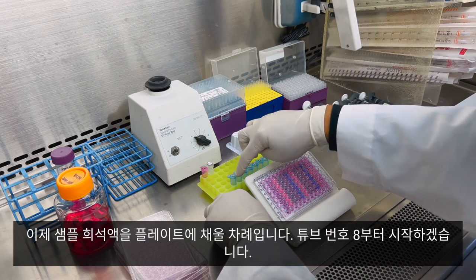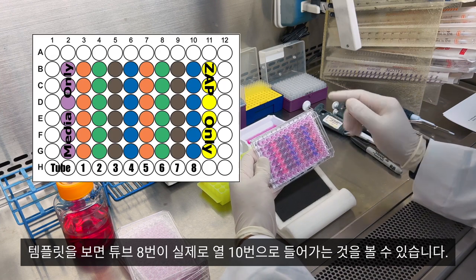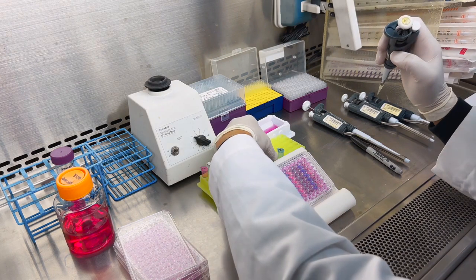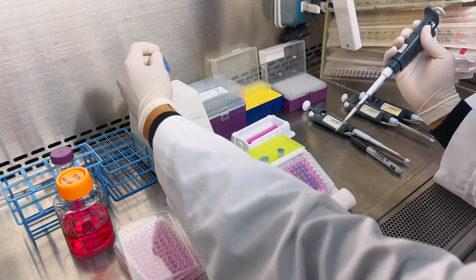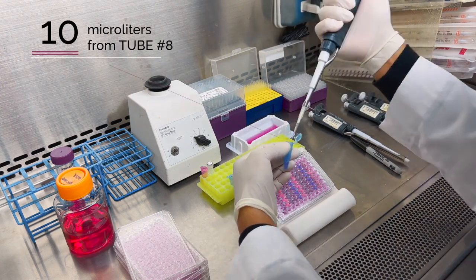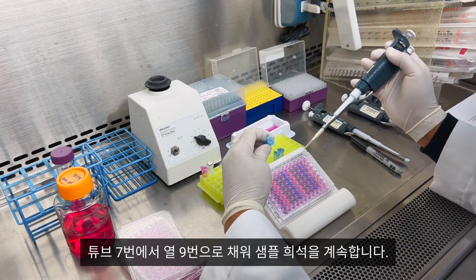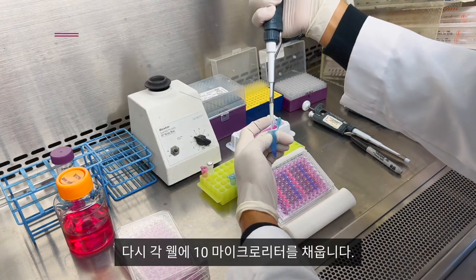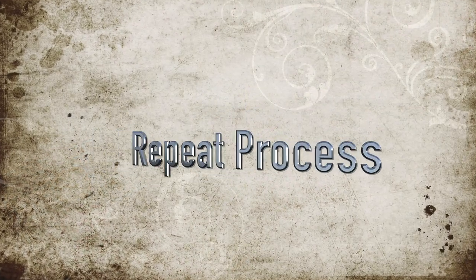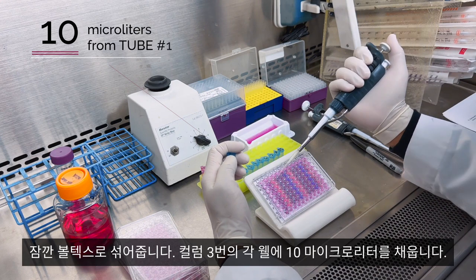Now it's time to add our sample dilutions to the plate. We will begin with tube number eight, which goes into column number 10. Transfer 10 microliters from tube number eight into each well in column number 10 — vortex briefly first, then begin adding 10 microliters to each well. Continue with tube number seven into column number nine, transferring 10 microliters into each well. Lastly, for tube number one, vortex briefly and transfer 10 microliters into each well of column number three.